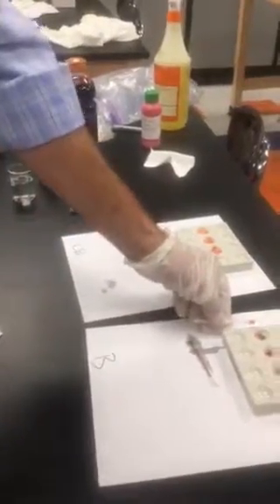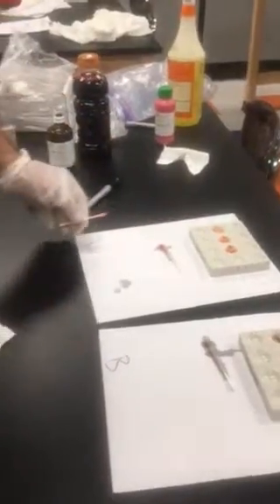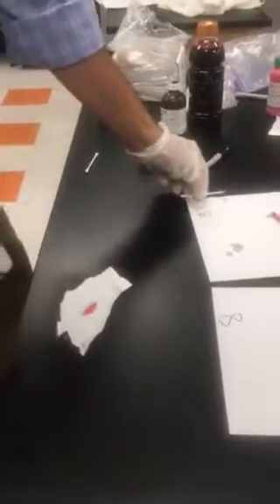And what do you think? Real or fake? I don't see the bluish green hue that I see here. It looks more like this. This is in fact not blood. We don't know what it is, but we know it's not human blood. And so that's what we mean when we say presumptive. We can presume now that this is not blood.